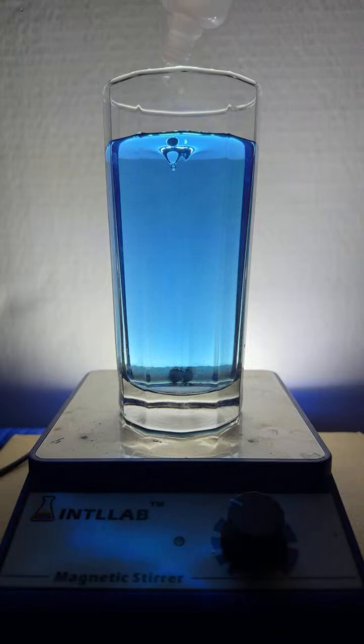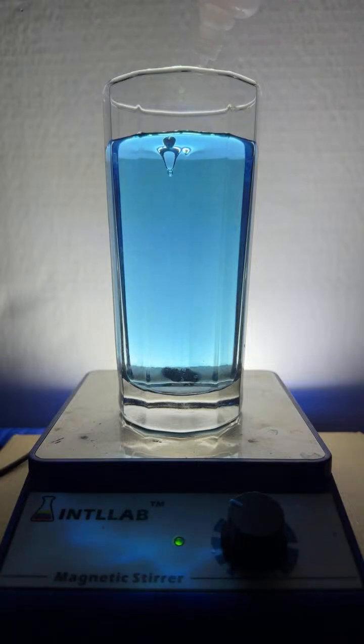I'm just wondering. You notice that blue color, I'm seeing it fade a little bit on my end as I'm adding the acid. I don't know if you're seeing the same thing. I'm whacking it pretty good here. I mean, that's quite a strong concentrate. But yeah, that definitely is fading. The color is definitely fading. It's taking a bit, though. Interesting. It's faded, but it's subtle.